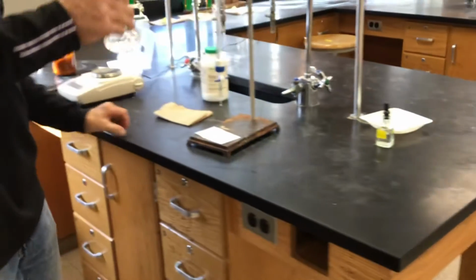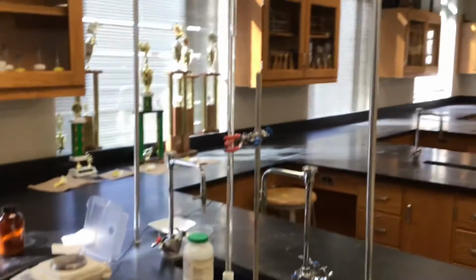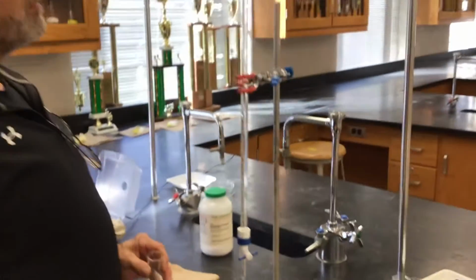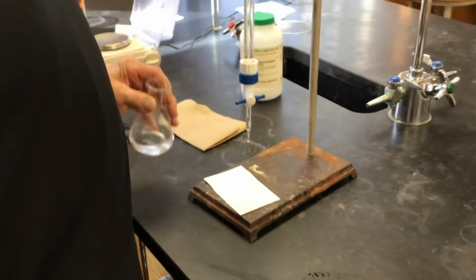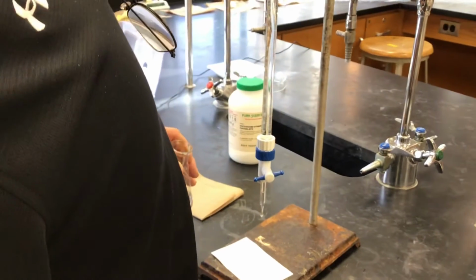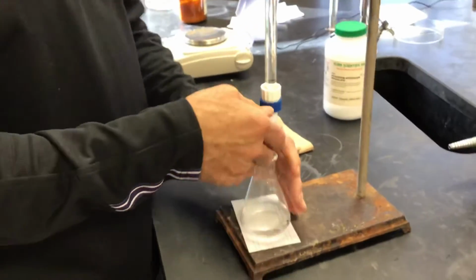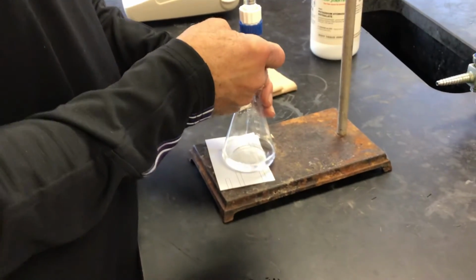Okay. Remember, the end of trial 1 is the beginning of trial 2. So we're at about 9.5. So if I run in a good 8, that'd be 17.5 or so. Just down here.